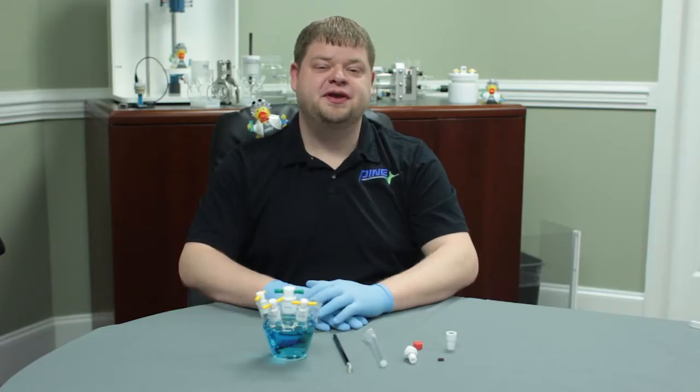Hello, I'm Tim Paschkowitz, one of the electrochemists here at Pine Research Instrumentation, and this is Dr. Redux. Hello. And today we're here to talk to you about the proper use and care of the standard size platinum counter electrode.